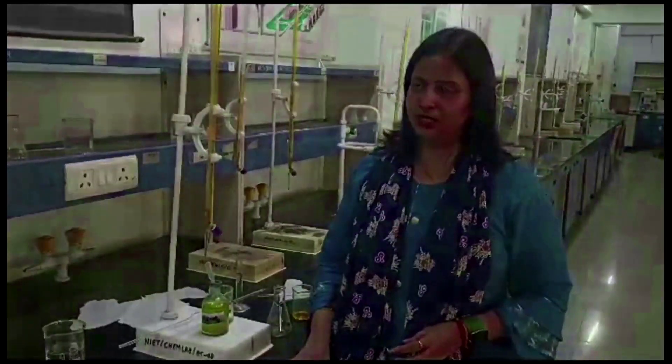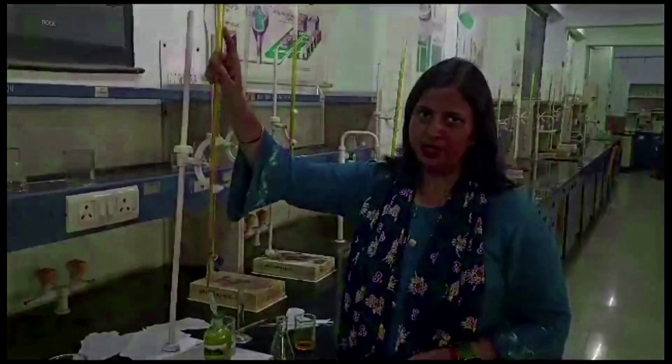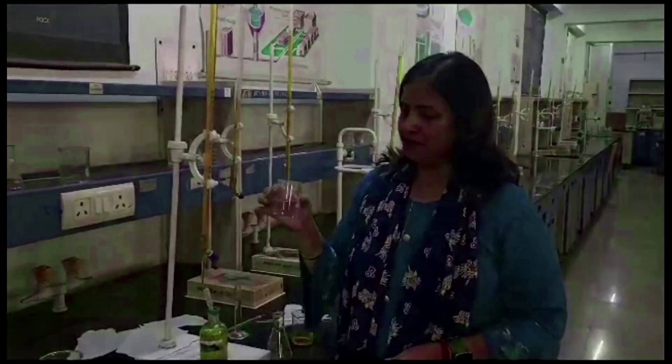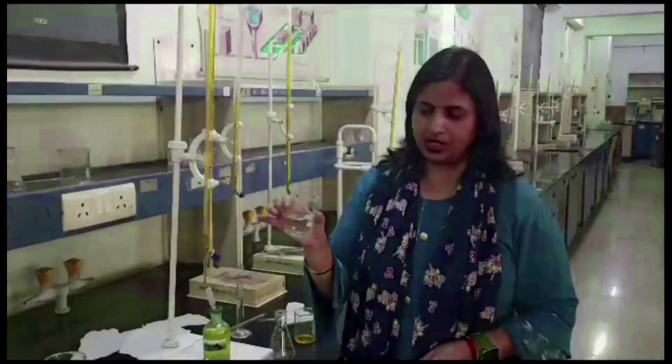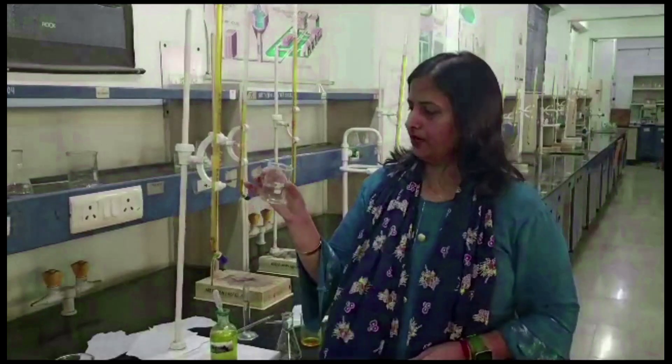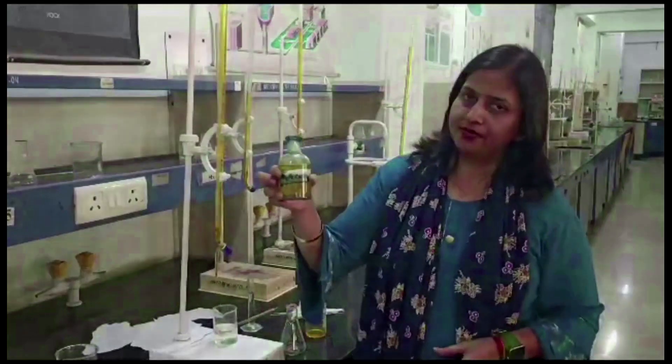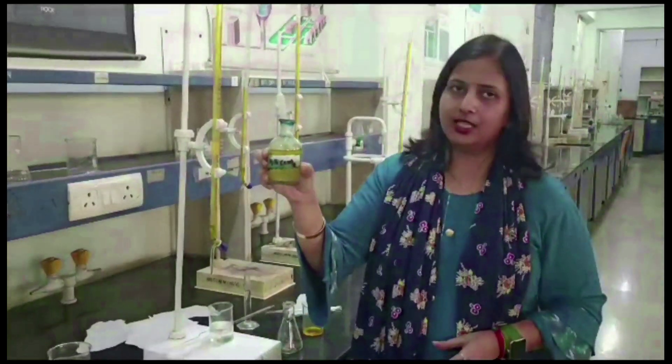Hello students, today we are determining the ferrous content in the given sample by volumetric analysis using potassium dichromate as a standard solution and potassium ferricyanide as an external indicator. This is potassium dichromate solution; it is a primary standard solution. The sample solution is Mohr salt solution, and we use potassium ferricyanide as an external indicator.